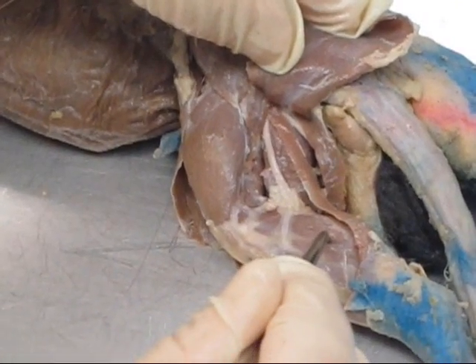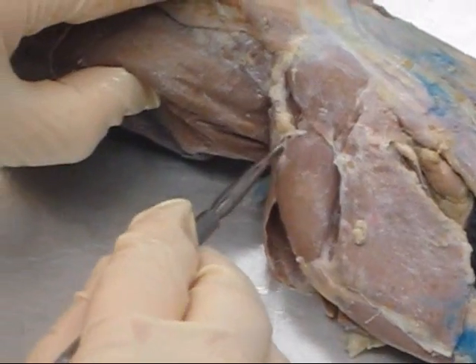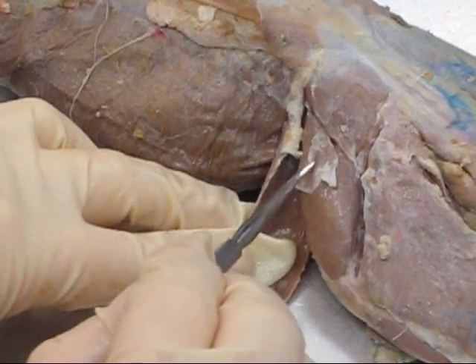Back to the mink's calf region, we have the gastrocnemius. One last muscle you can see very well in this view, kind of hiding up in here — there it is, the tensor fasciae latae, right in here.